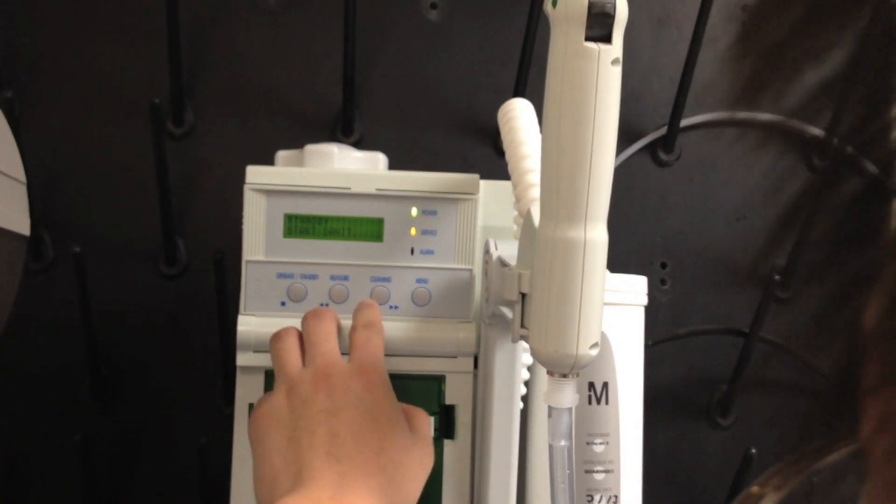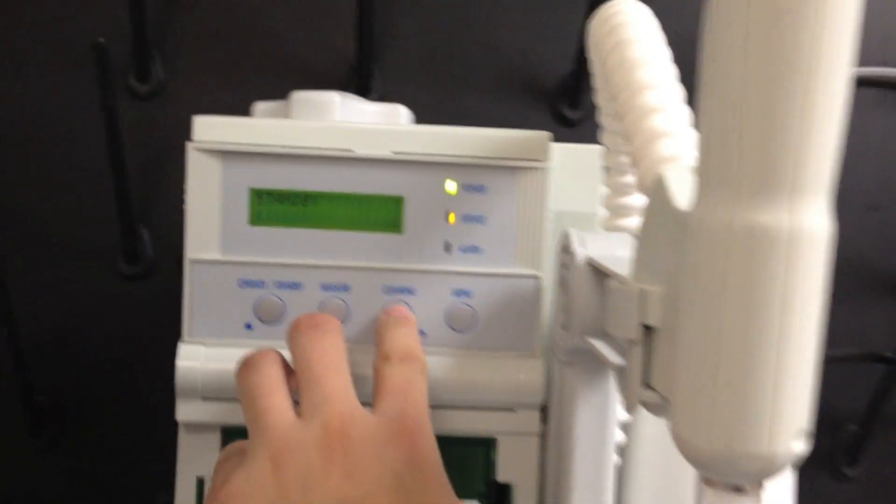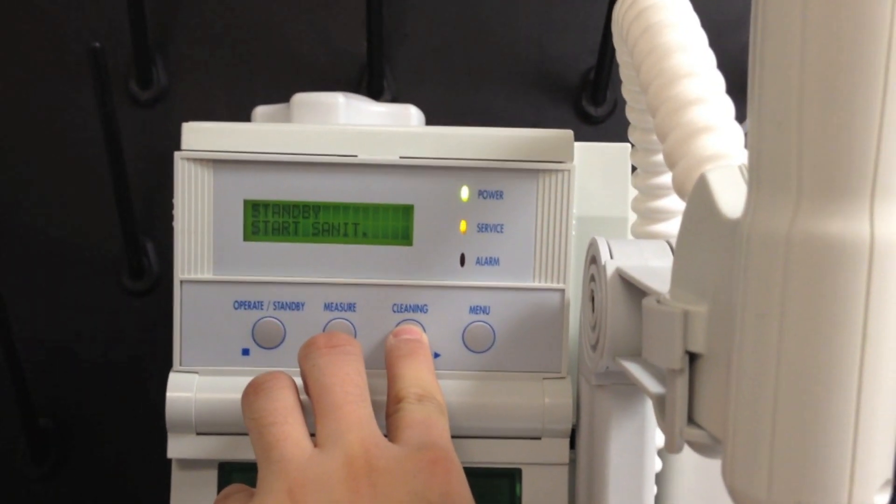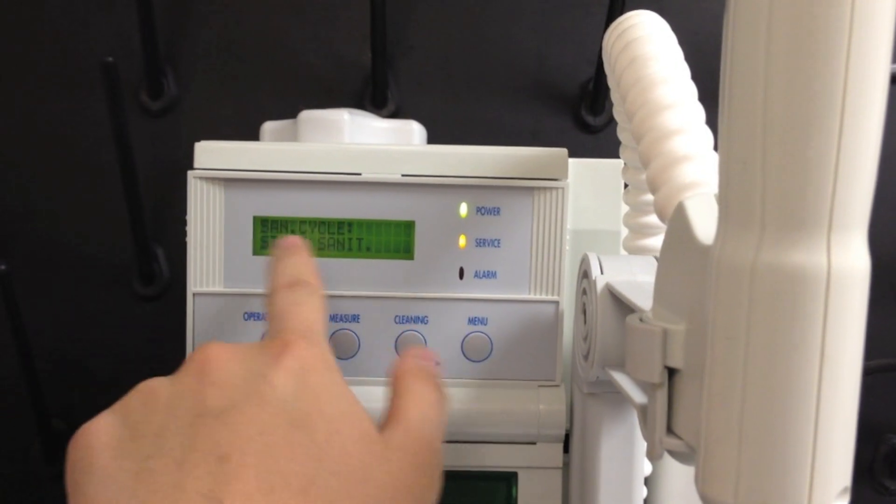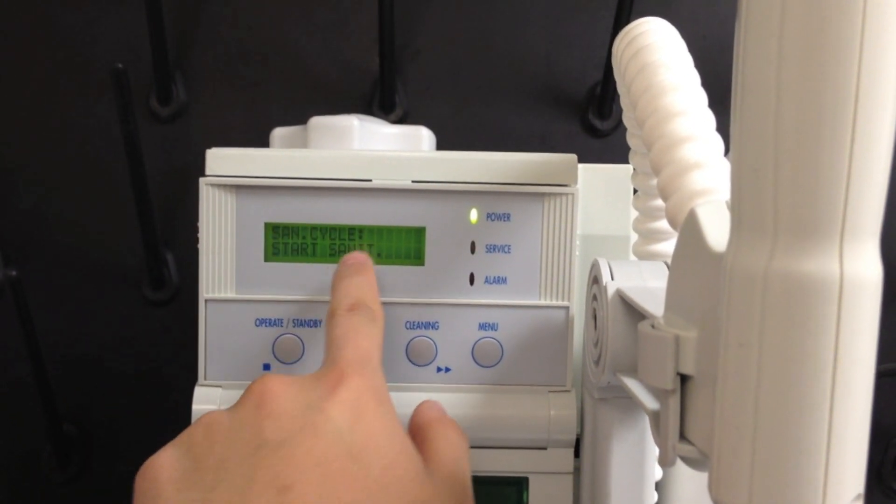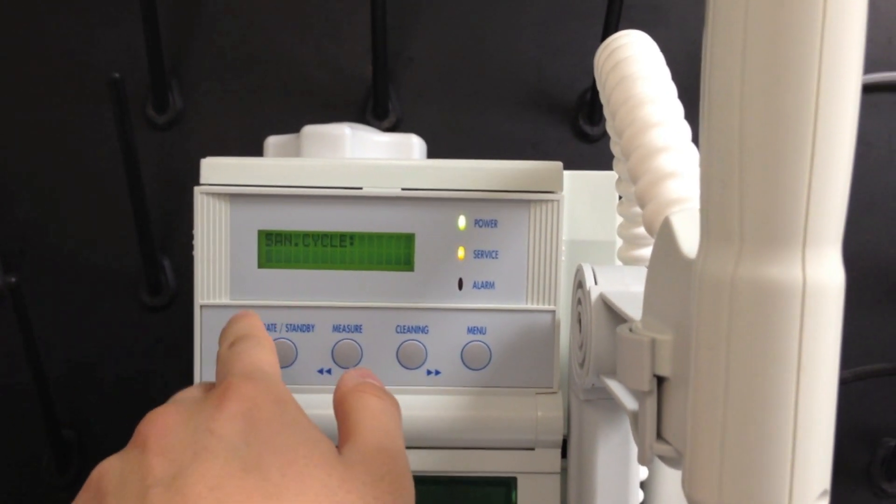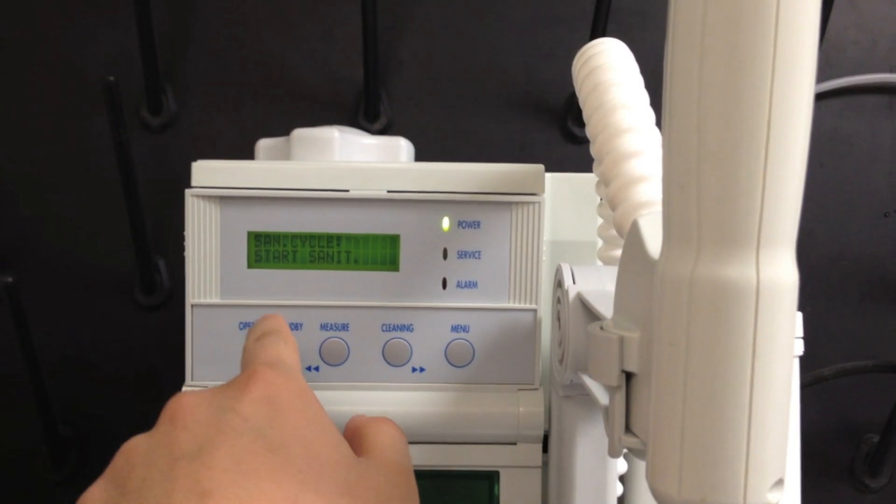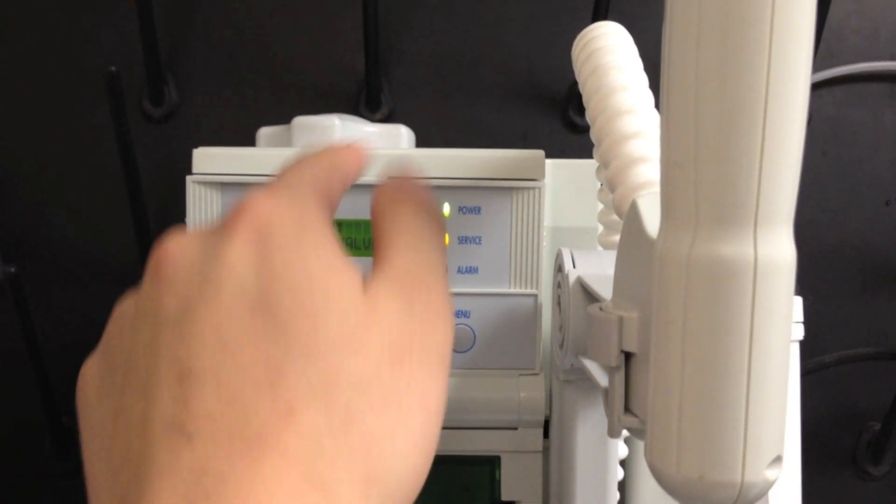And now you hit the cleaning mode. Okay, now it says sanitation cycle. Wait for about 10 seconds. It will ask you to open the valve. So just follow, you open the valve.